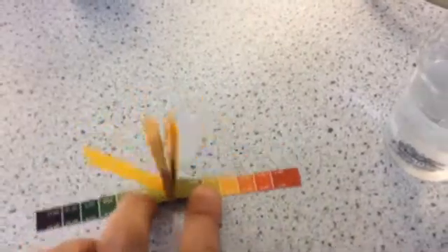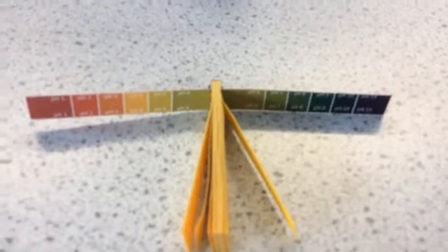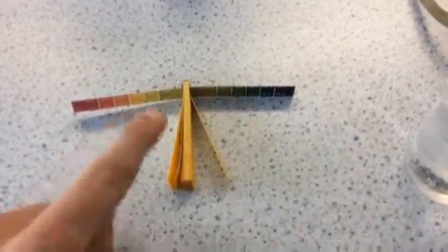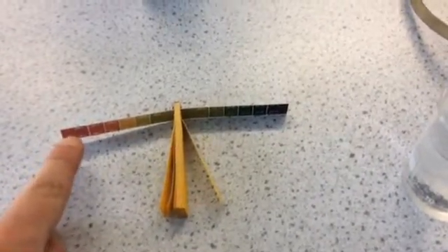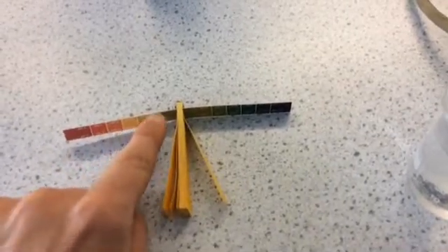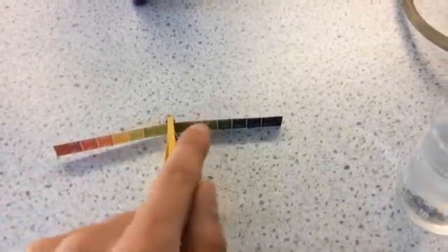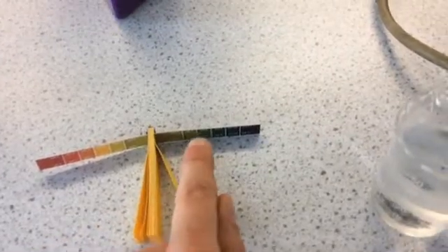And if you have a look either side of the strip here, you can see it's got the pH scale on it. So this is pH 1, the red, which is the most acidic something can be and then you can see the reds gradually turn to orange and yellow and then very pale green. So those are the acids getting less and less strong. pH 7 is neutral and then you can see on the other side of the scale as the green gets darker going into blue and then eventually purple, that's the alkalis.